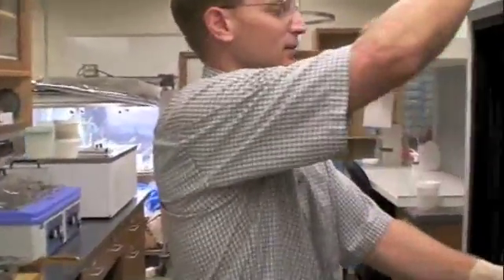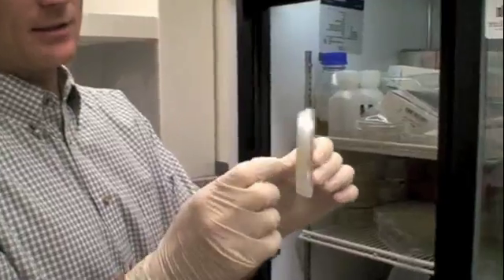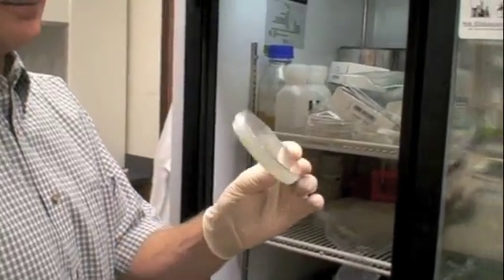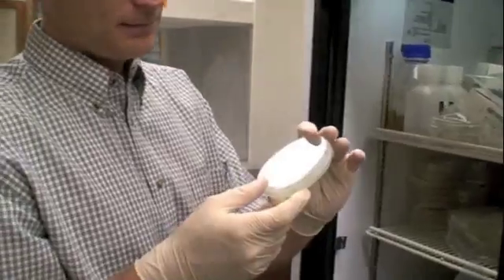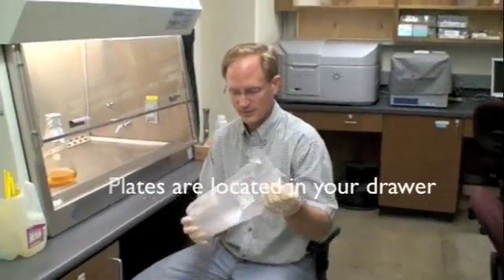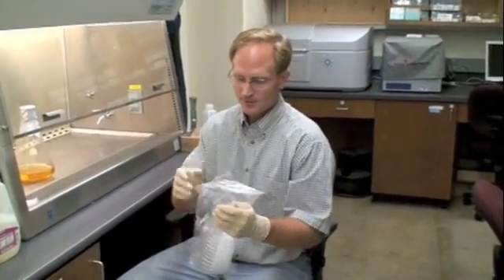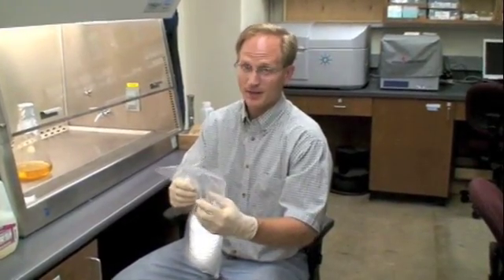Our culture plates are stored in this fridge, and we want to generate something like this, that's a hard agar that we can grow our E. coli on. So now I have 10 petri plates here, this is a sleeve of petri plates. 10 have been used already. It's been used incorrectly, and I'm showing you a bad example here.